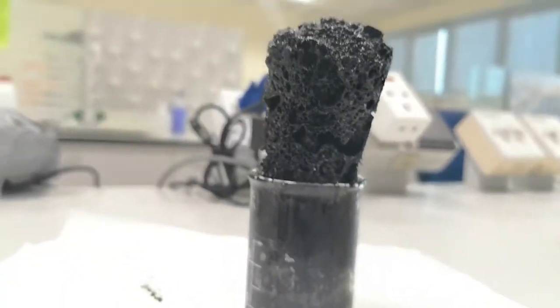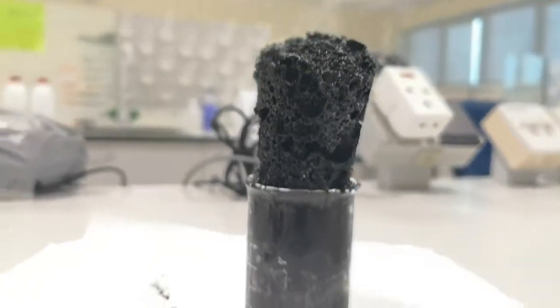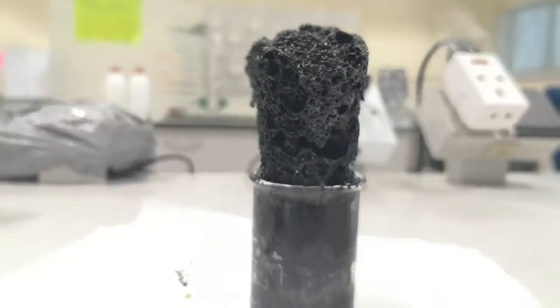I also smell the caramel smell. This is because the sugar was burning in this sulfuric acid.